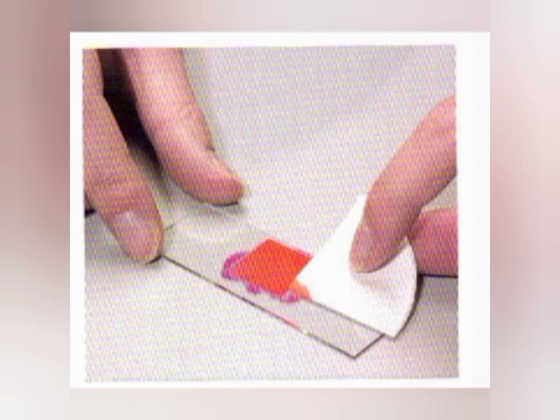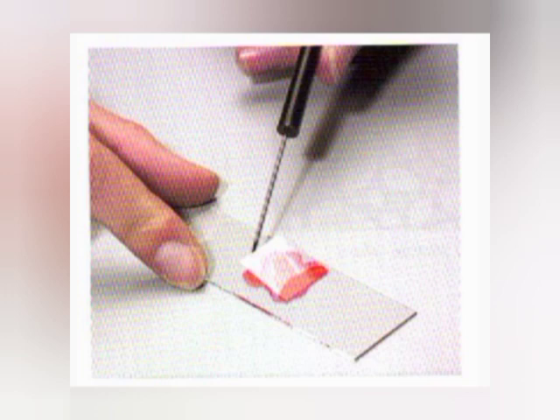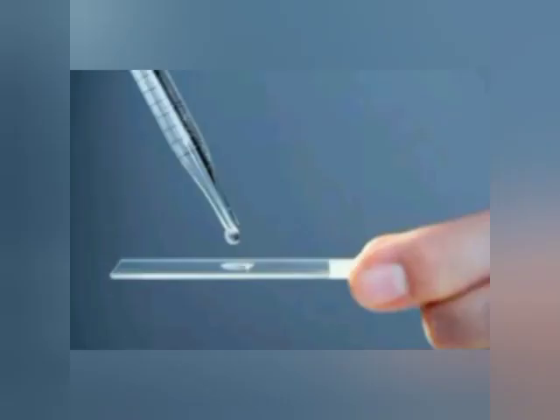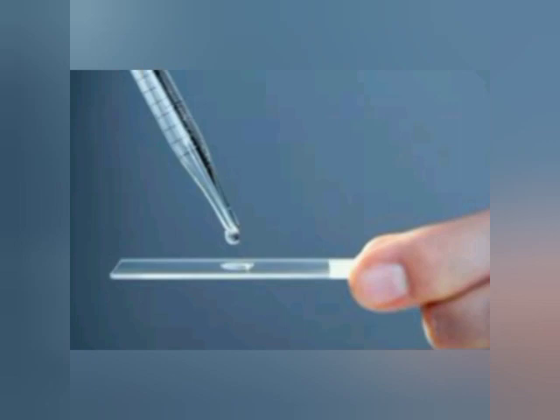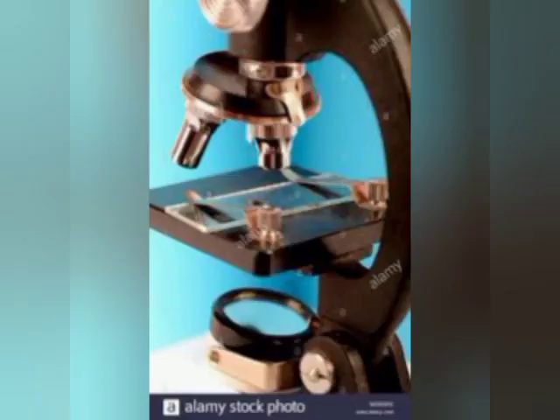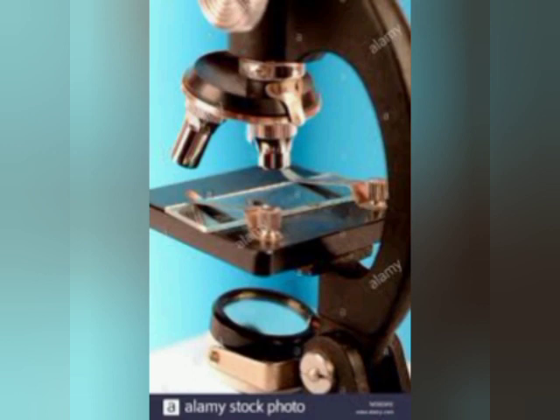After that, take a coverslip. Before placing it, add one drop of glycerin, then cover it gently with the coverslip. Now observe this slide under a microscope.